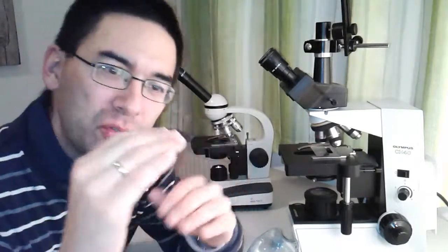Now, there are those little compressed air bottles, which actually don't contain air, that you can buy, and they're used for de-dusting, for example, computer keyboards. I was thinking about using them for de-dusting the microscopes when I read that this is really dangerous to do, because in most cases it's not compressed air, but there are some organic substances in there, and there is the possibility that if you de-dust your microscope with that, there's going to be some kind of layer, a coating, on the optical surface because of the impurities in the can.